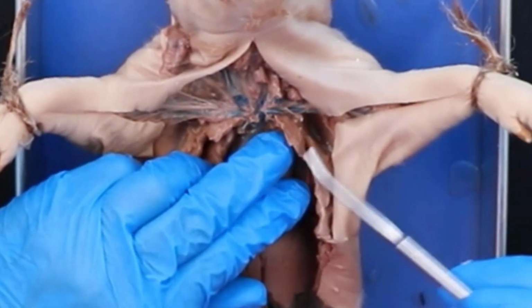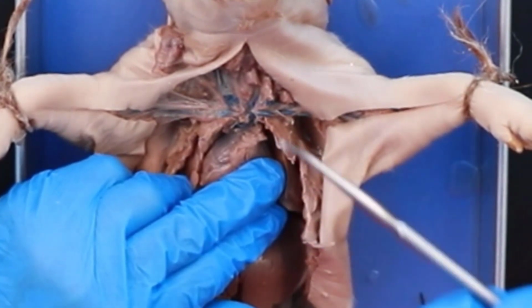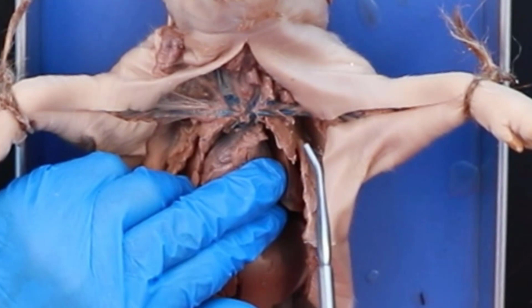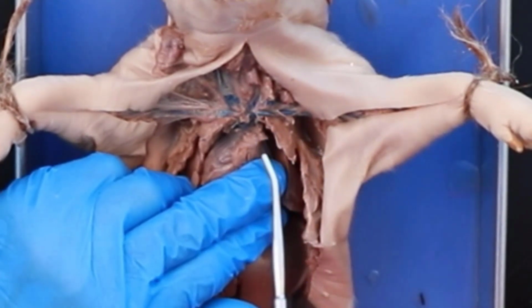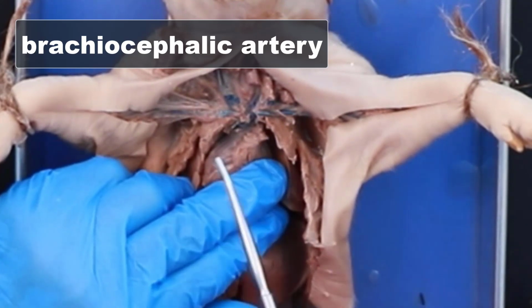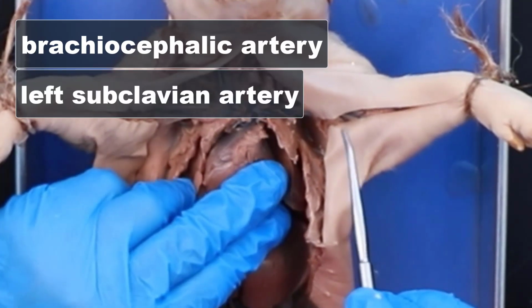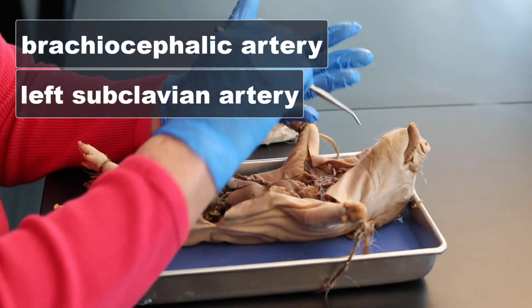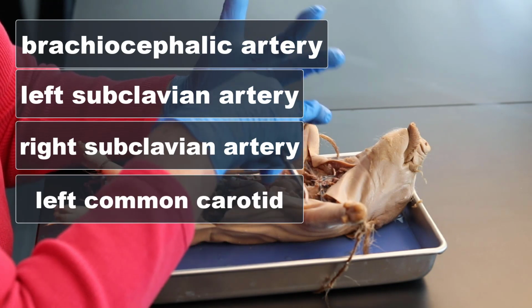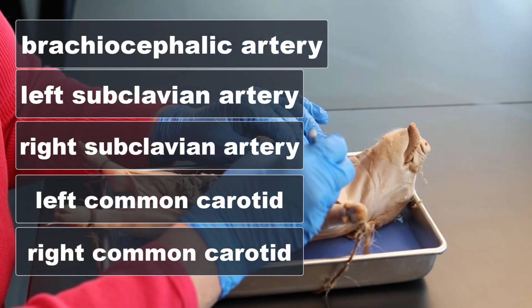All right, now coming out of the heart, we're going to come over here. You don't really see the arch too well, but don't forget that in pigs and cats and dogs, there's only 2 vessels off the aortic arch, okay? You have a brachiocephalic artery, and then you have the left subclavian. All the vessels, your right subclavian and your left common carotid, your right common carotid, all come off that brachiocephalic artery.